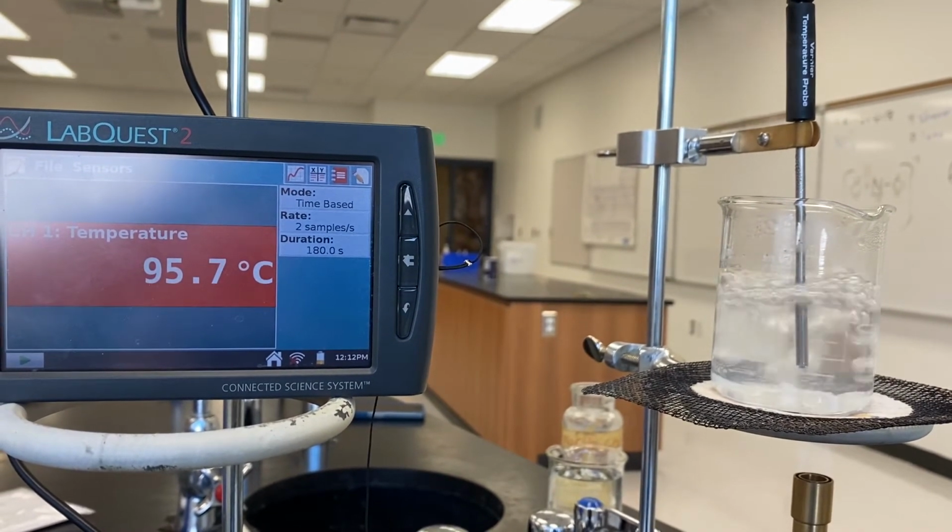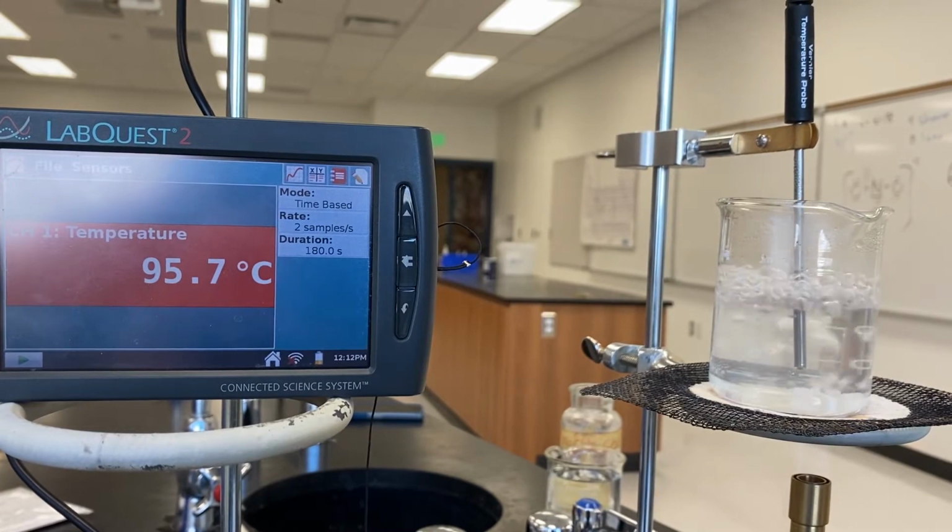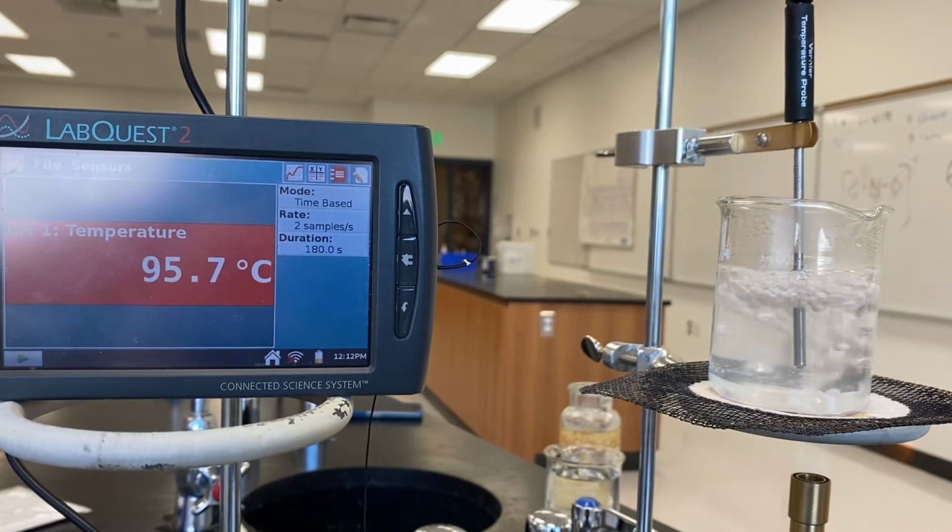Just gotta hang on. Sorry. Give that a couple more seconds. Seems pretty stable.